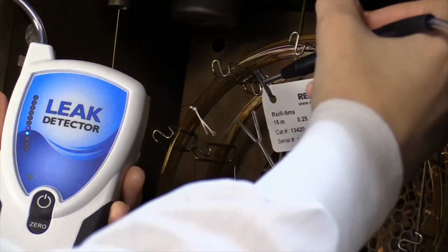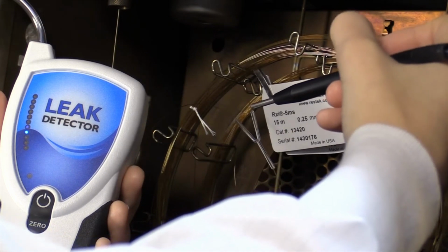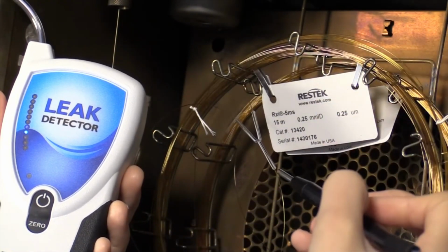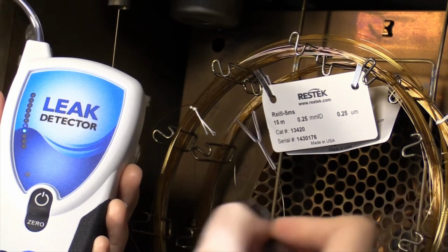Column connectors are common sources for leaks, even if they are leak-free after initial installation. Check them regularly during use. Reinstallation may be necessary if you discover a leak.